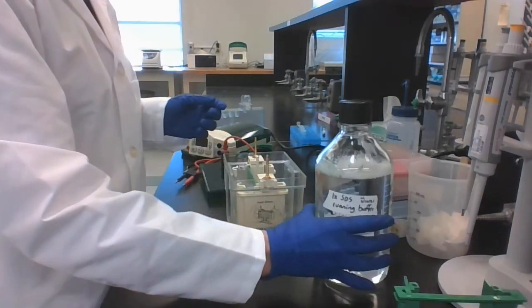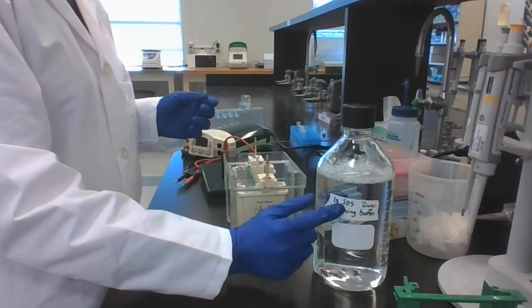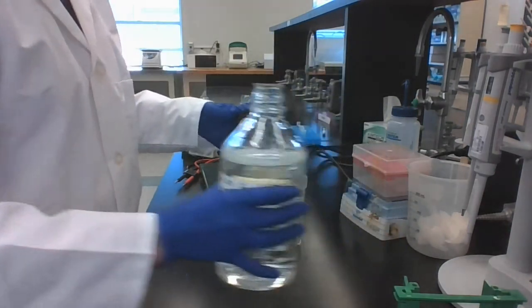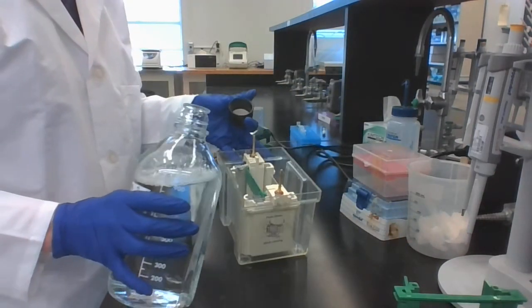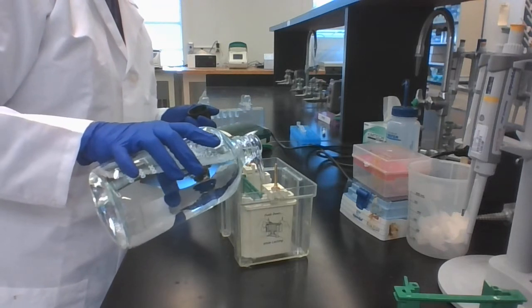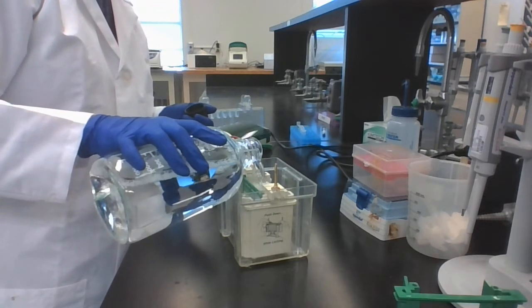Your next step is to load it with running buffer. We have 1X SDS-PAGE running buffer. You want to fill it in the middle all the way to the top. So in between your buffer dam and your gel, fill it all the way to the top. You can actually even let it overflow.